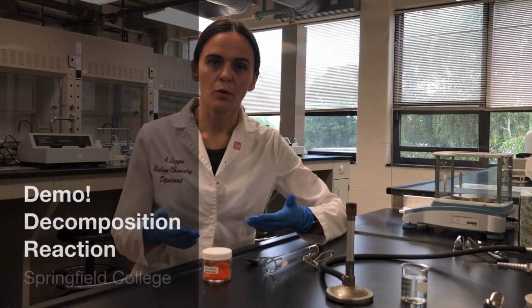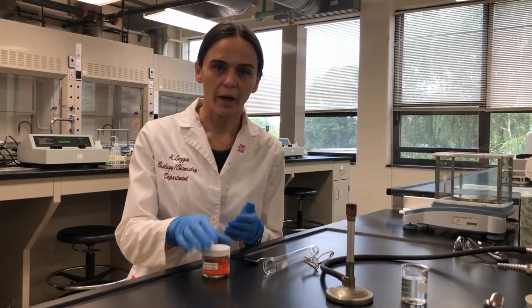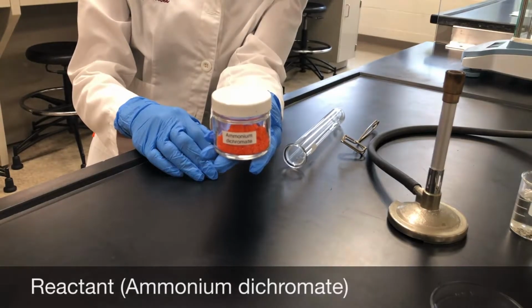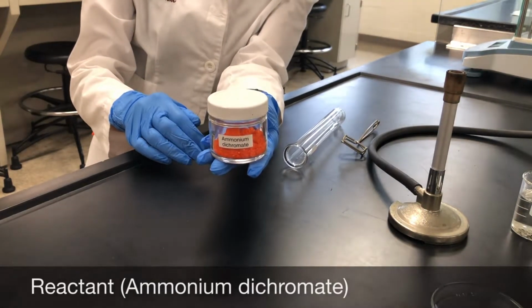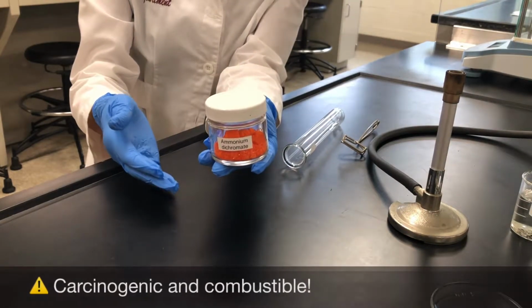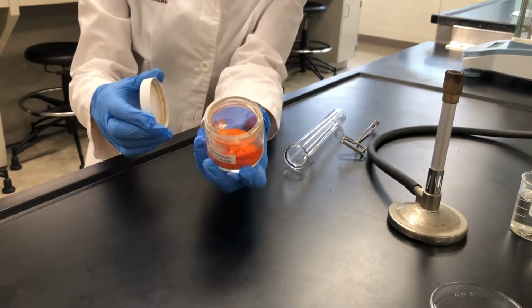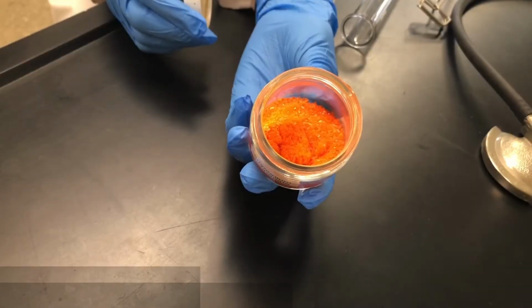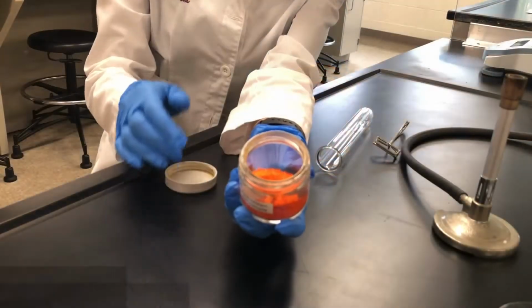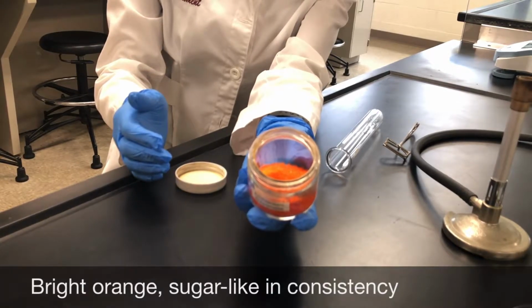Observe the demonstration portion of the lab, and this is an example of a decomposition reaction. I will be using ammonium dichromate to perform the decomposition reaction. A little bit about the ammonium dichromate. It is a carcinogen and it's also combustible. So let's uncap it and look at some of the properties. So we can describe it as bright orange and sugar-like or crystal-like in consistency.